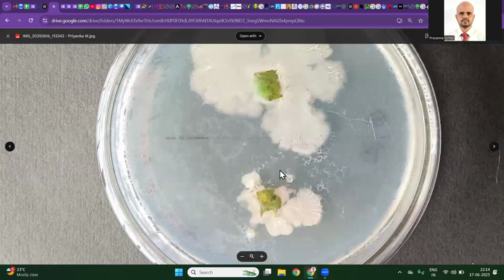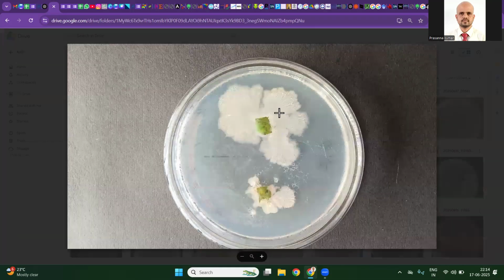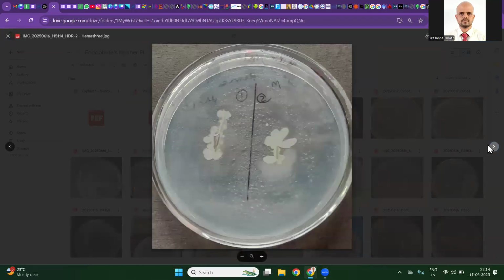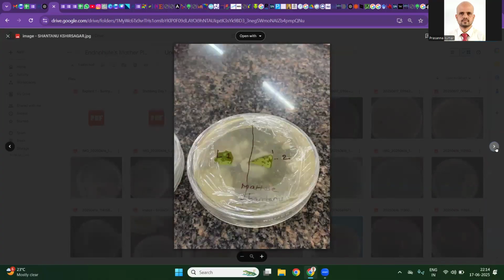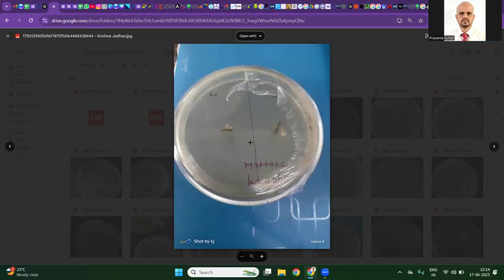Here also, the growth is actually coming from the explant. So if the imprint is clean, it could be an endophyte. Same observation: growth should come from the explant. Like this. So it's a malt extract agar. Use an appropriate background for the photograph. Always take the photograph near the window or using natural light, which will capture more details than your white light.